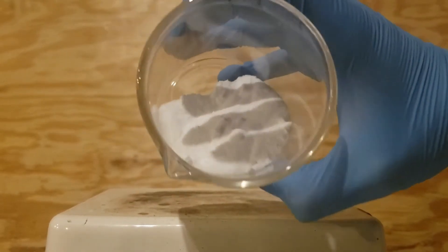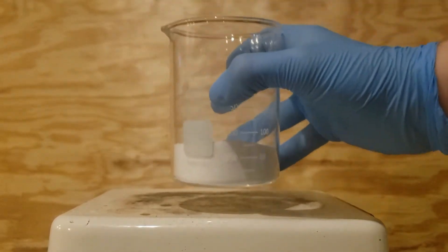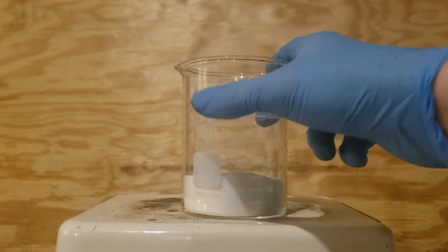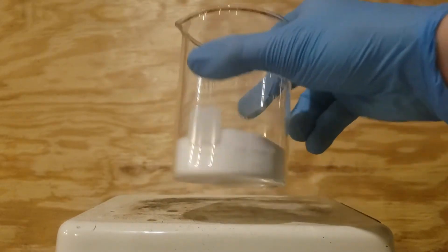So in this beaker is our sodium tetraborate. I added a stir bar to this and tried to mix it. However, as you can probably imagine, that didn't really go anywhere.